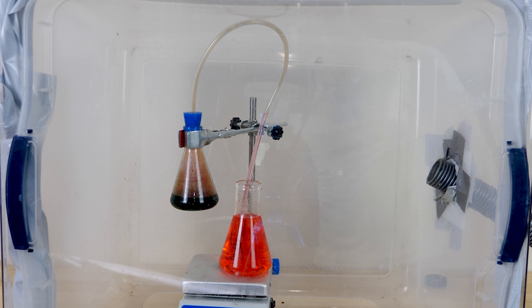Now it's going up the tube. It kind of gets stuck there for a little bit. And then it keeps going. So why is this happening? Now the water is getting sucked into the original jar. So it's filling up the first flask.